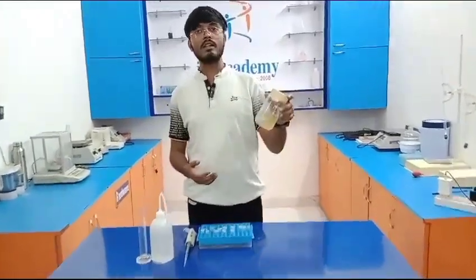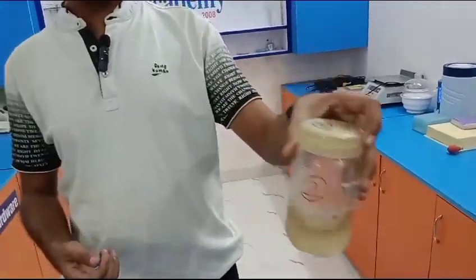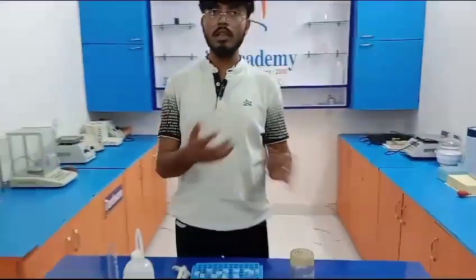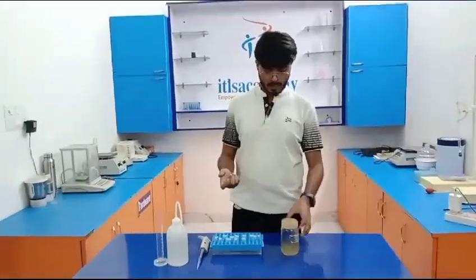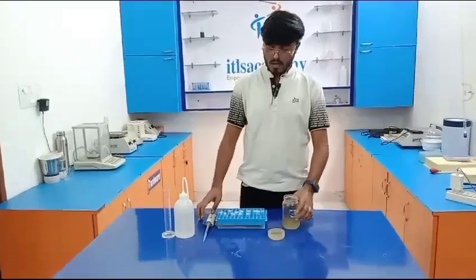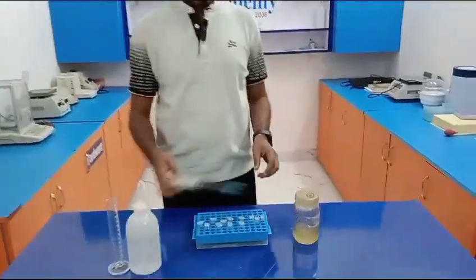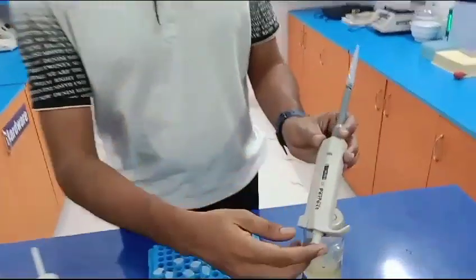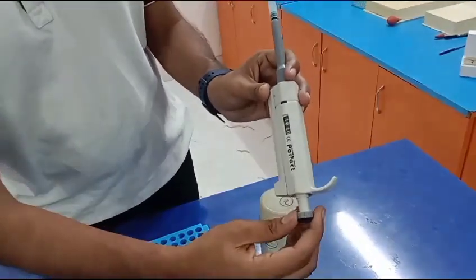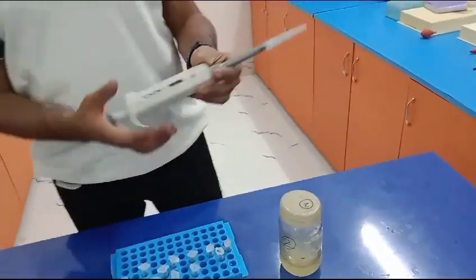We kept it for incubation for at least one week for enzyme production. Here is the result after one week of incubation. So basically what we are going to do today — with the help of this micropipette, we need to set 1000 microlitres. Here I have set 1000 microlitres.